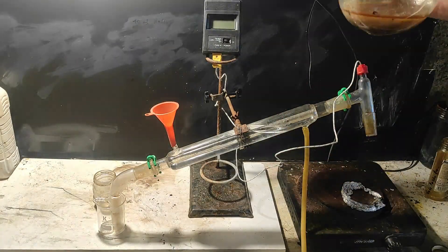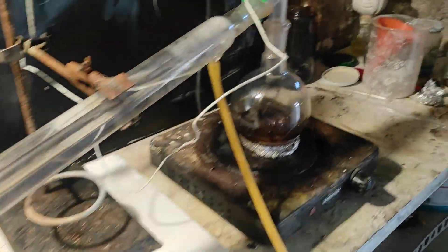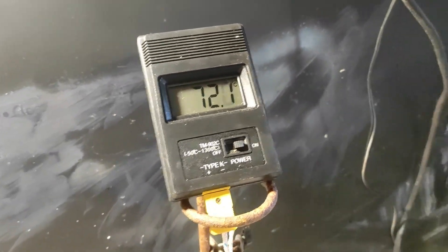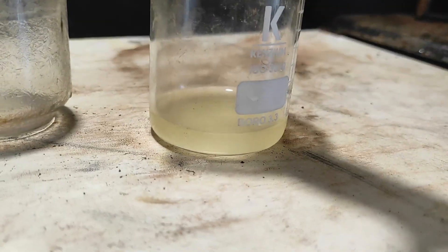And again, we collected the distillate from 69 to 82 degrees, and it looked a little bit cloudy at first, which means there is some water in it as well, but we'll remove it later.